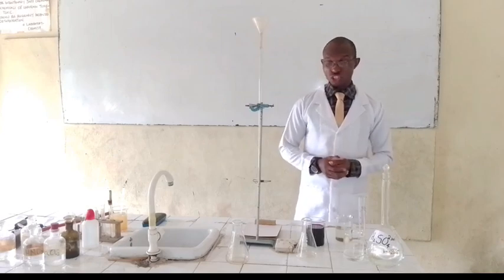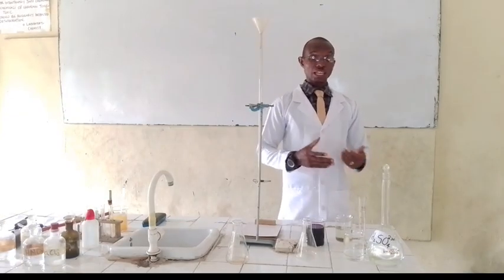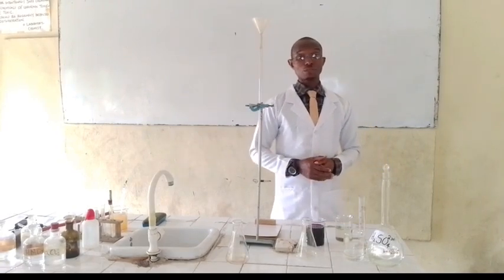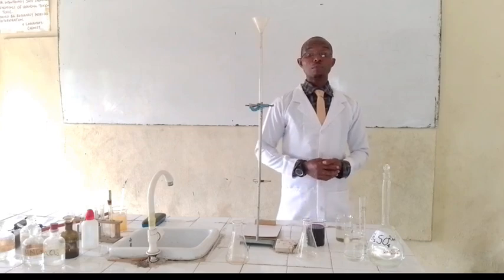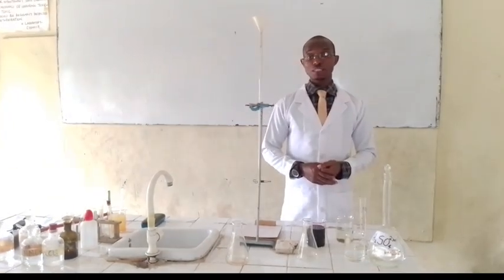Our acid for this experiment is going to be the potassium permanganate, while our base is going to be the iron sulfate. WAEC has asked us to prepare the potassium permanganate using 1.58 grams per dm³, and for our base — the iron sulfate — we are asked to prepare it using 5.5 grams per dm³. So we have those substances prepared already.